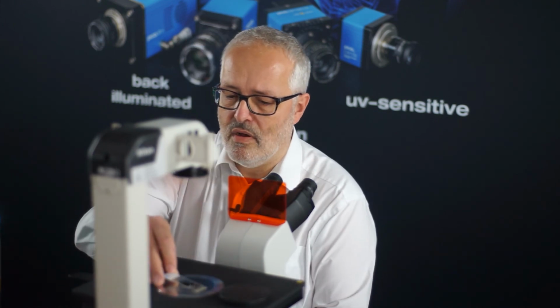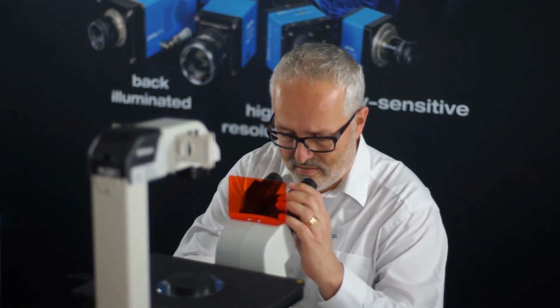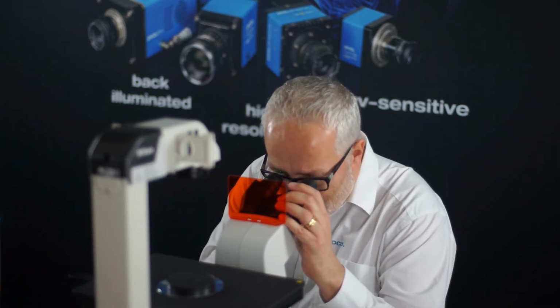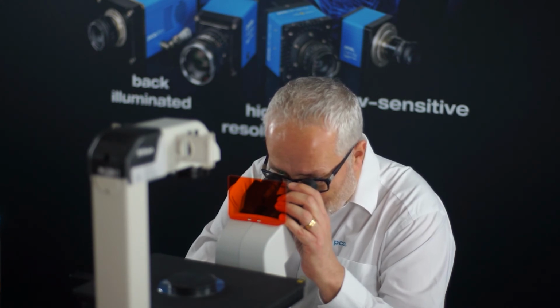And the procedure for a measurement is very similar to the reference measurement. So you place this sample on your microscope, cover it, switch on the light, have a look, focus, and then select any area of interest to do the measurement. And when you've figured out the right spot, then the same procedure: you switch to the camera and have a look with the software, maybe refocus, and do your measurement.